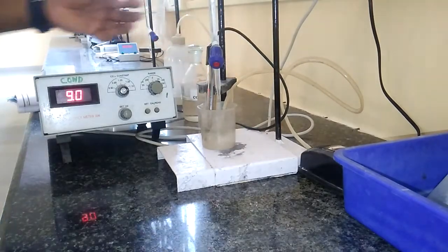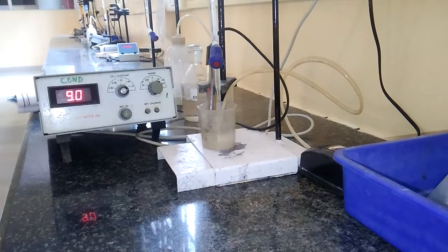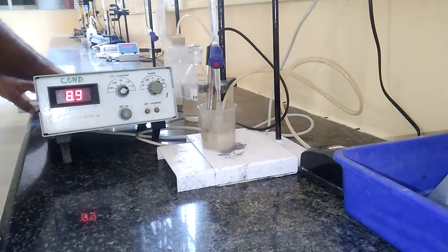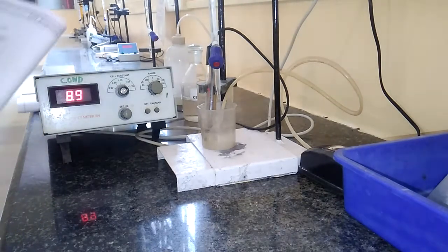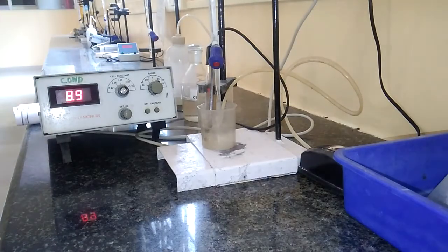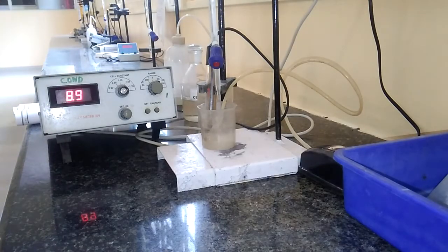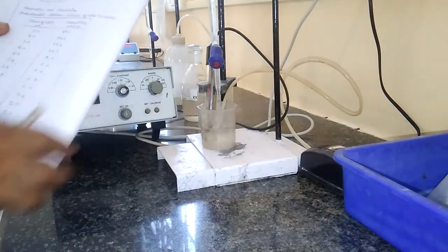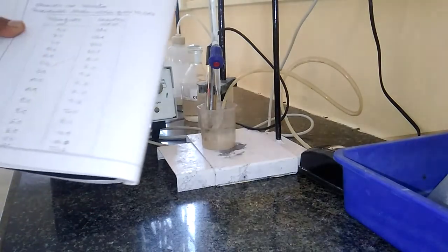From the burette, the more the OH⁻ ions added, the greater will be the conductance values. Like this, there will be a lot of changes: initially it decreases, after that it slightly rises, after that it suddenly rises. After recording all values up to 10 ml, we have to stop the titration.